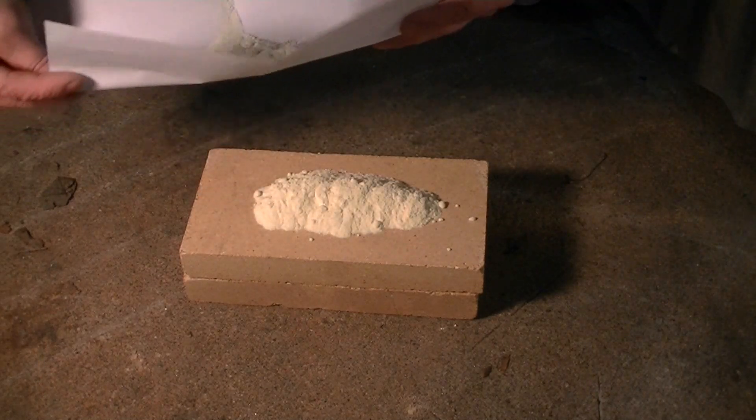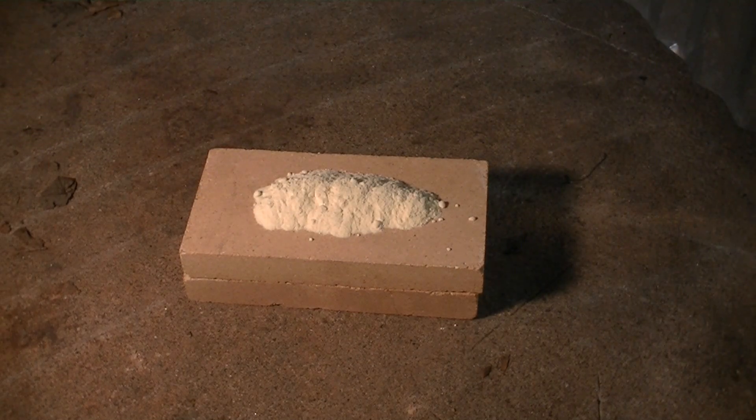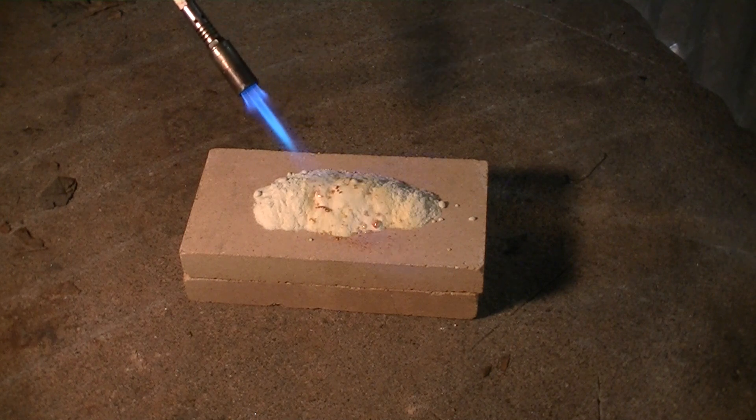In our first demonstration we have poured out some sulfur onto a fire brick and we're going to show sulfur burning in air.